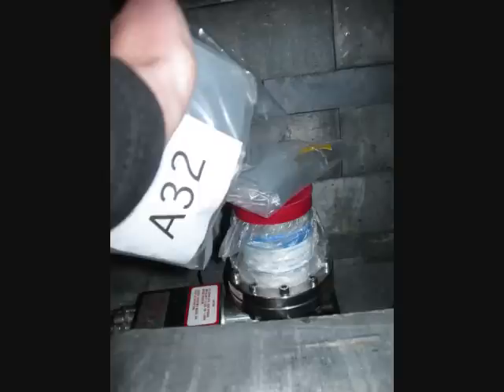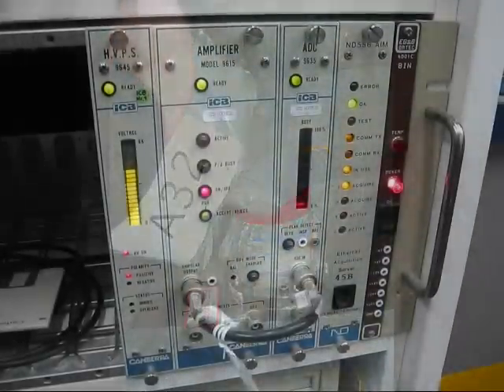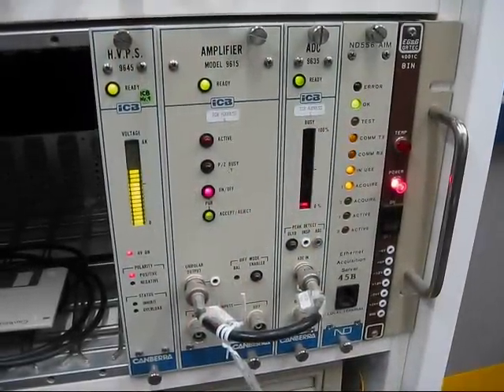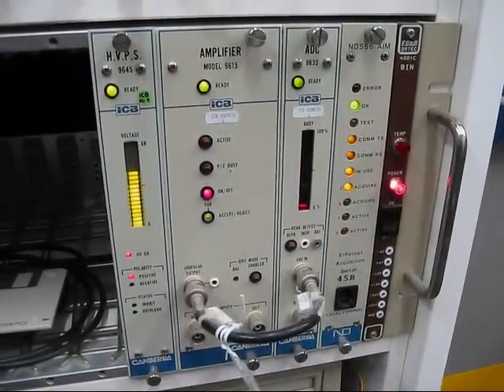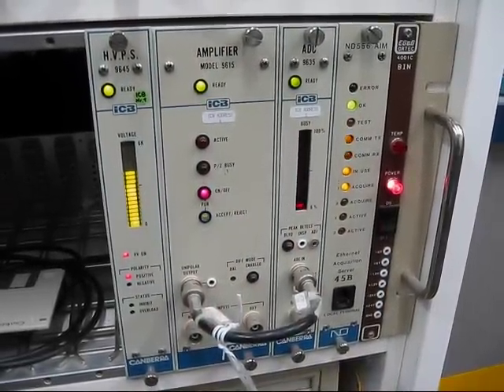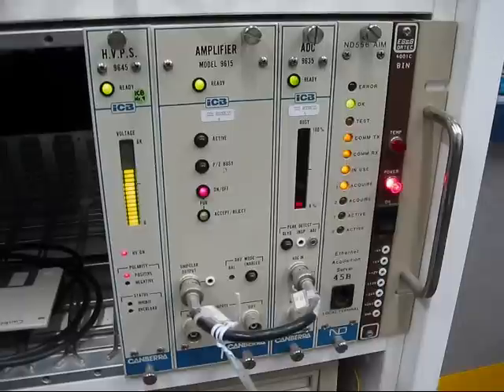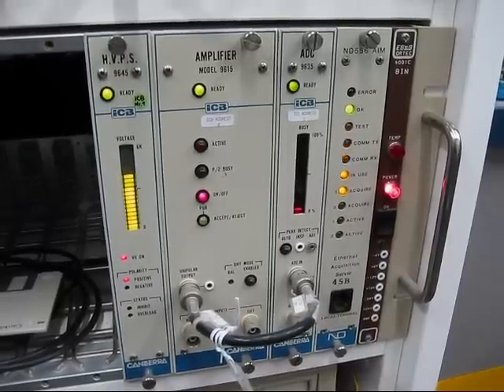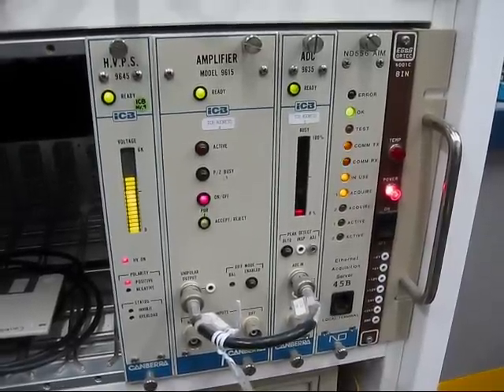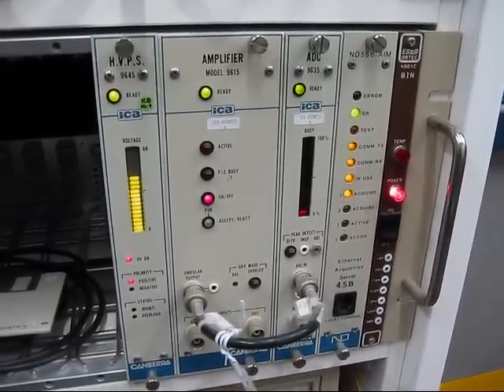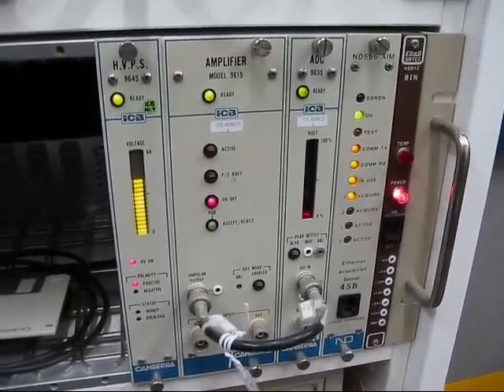So here you can see the detector itself, the high purity germanium crystal, which is underneath all that cover, cooled with liquid nitrogen. Let's see what happens. And we're getting a lot of blinking lights. That means quite a lot of activity, or more like gamma rays, hitting the actual crystal. Let's see what our spectrum says.